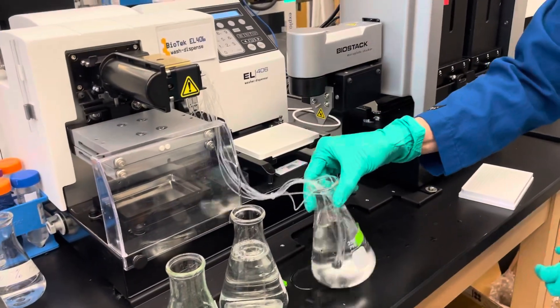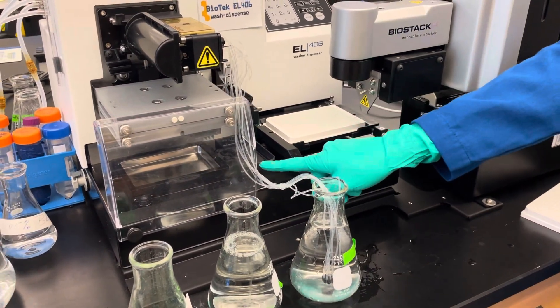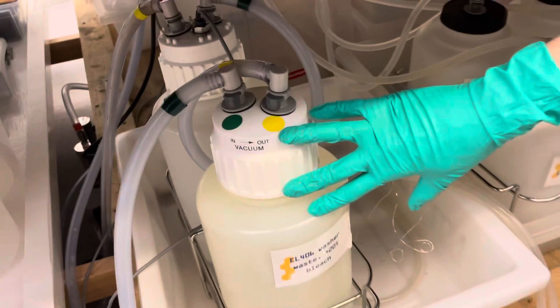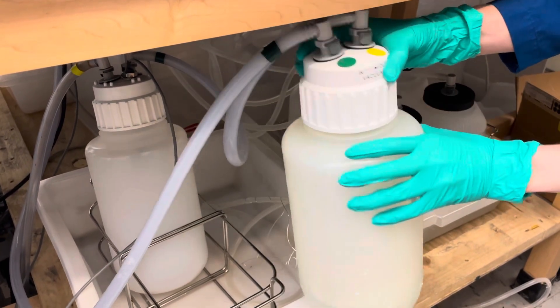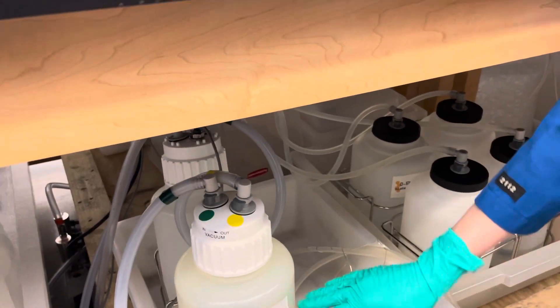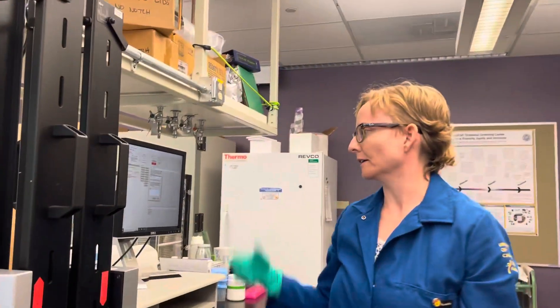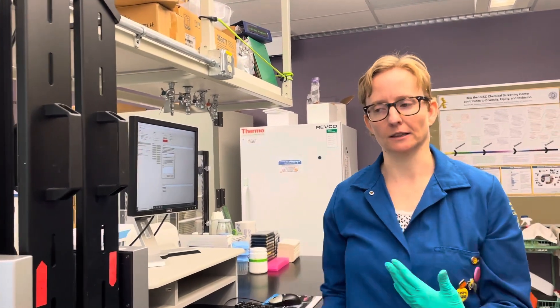We're going to give DI water for a final rinse — make sure we get it good on the outside. When it primes, this is the waste collection bucket; all of that liquid gets collected into this waste bottle. You want to make sure you never let this fill more than two thirds full. If you do, you have to unscrew the lid, go dump it in the sink, and put a little bit of bleach inside before re-screwing it back on. If it gets too full, some liquid will overflow into the backup bucket, which has a sensor, and it will cause your protocol to stop — because it's protecting the vacuum pump from getting liquid sucked into it.